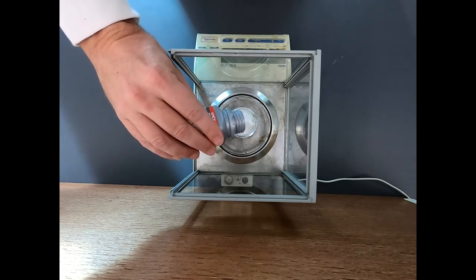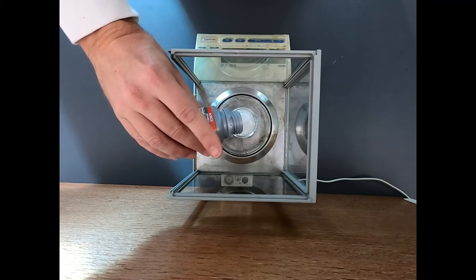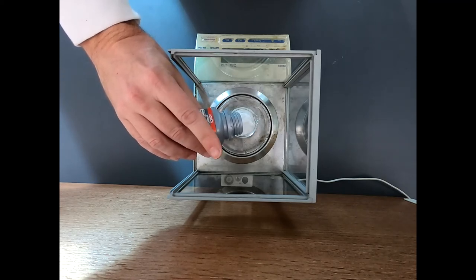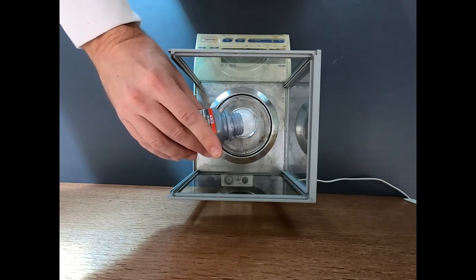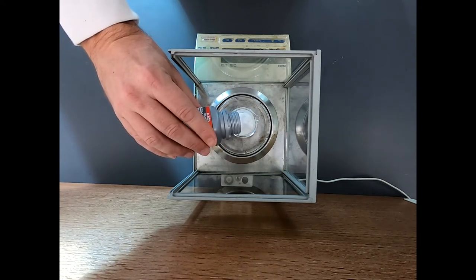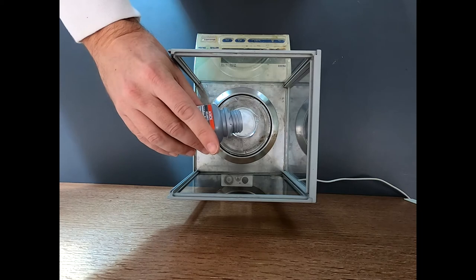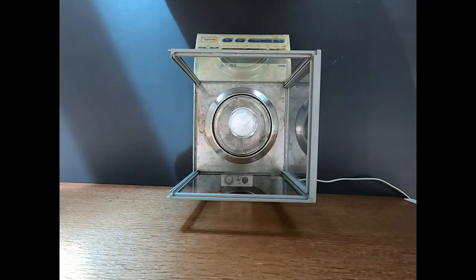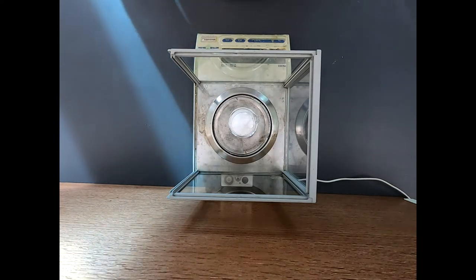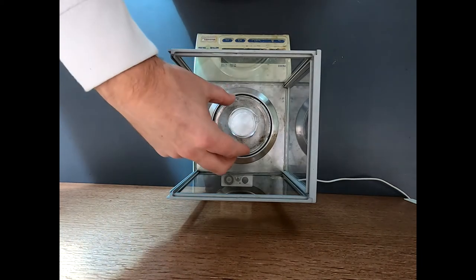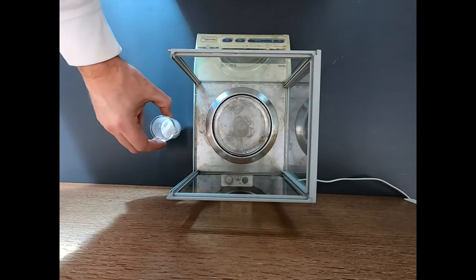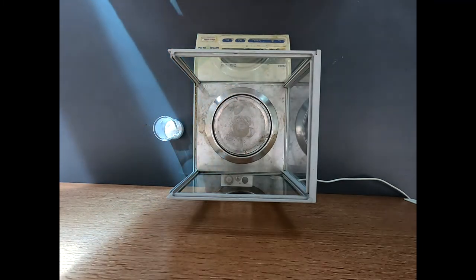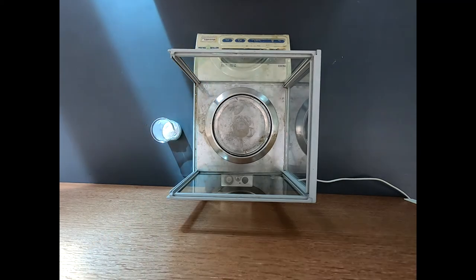Anything over say 12 grams is going to be adequate for this reaction. So we're up to 9 grams. 10. This is a lot of sodium azide. 11. I know this is just great watching, watching someone measure. 12.2. I want a 12.3. That is 12.397. Let's just call that 12.40. So that's all the azide we need. Now we'll take this off. We'll go into the hood and we'll add our solvent and add our azide and get this reaction started.